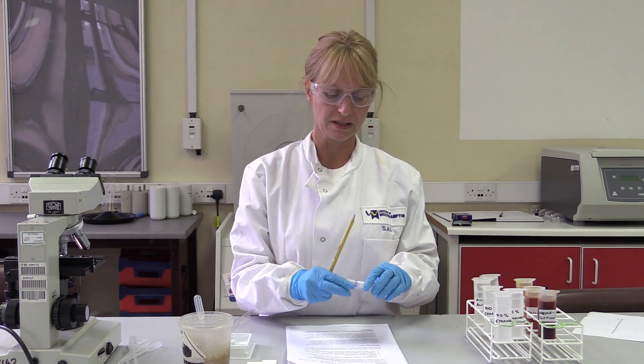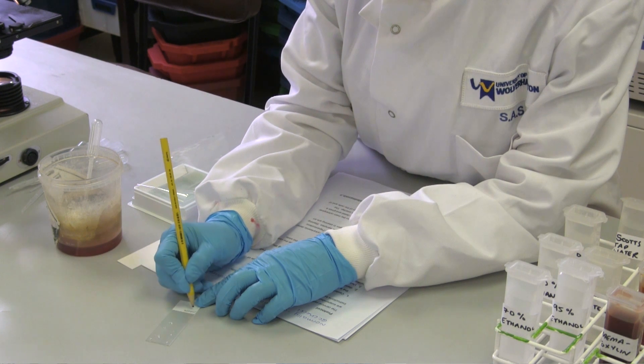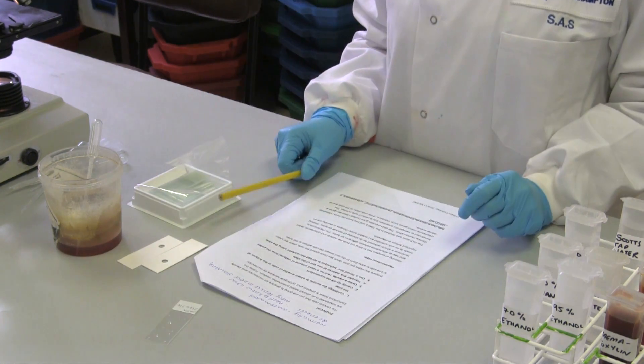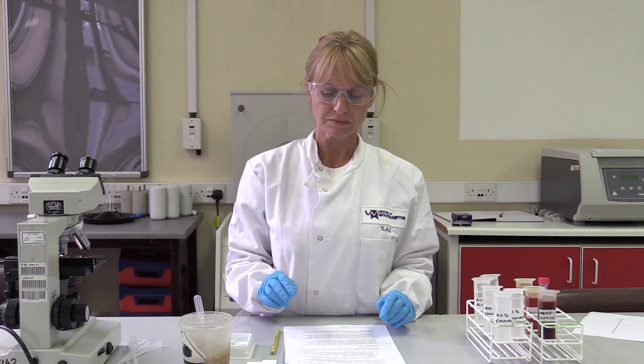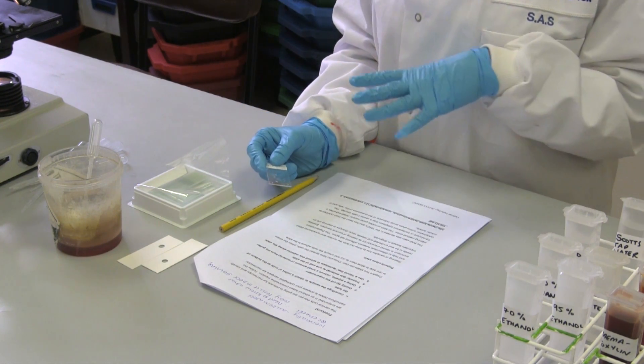The next stage is to put your name and student number on the slide, because these slides will be handed in at the end for assessment. Write your name and student number clearly. Make sure that the sample is not thrown away, as these pathological samples have to be discarded correctly. Once your slide has dried, it's ready to be stained. As you stain the slide, you're going to be looking at what role each of the steps has.